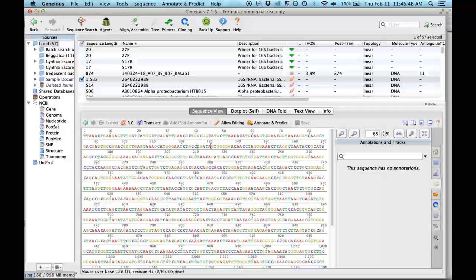Now we have the sequence here, and the first thing I will do is look for the position of the primer. We can just work with the sequence that we are amplifying, because in the PCR you just have the fragment. You will not have a digestion of the entire 16S. You will just have the fragment that you're amplifying with your primer.